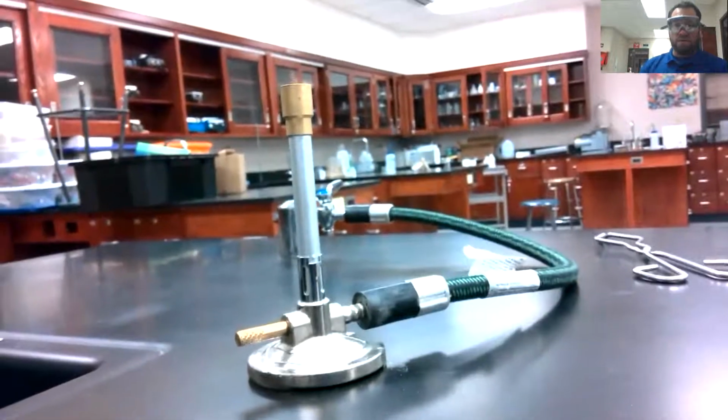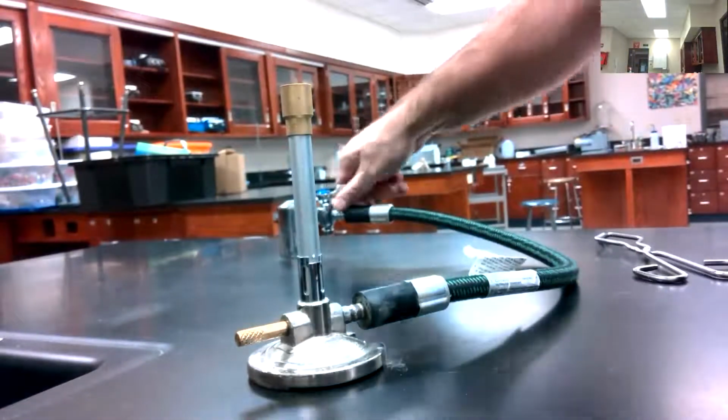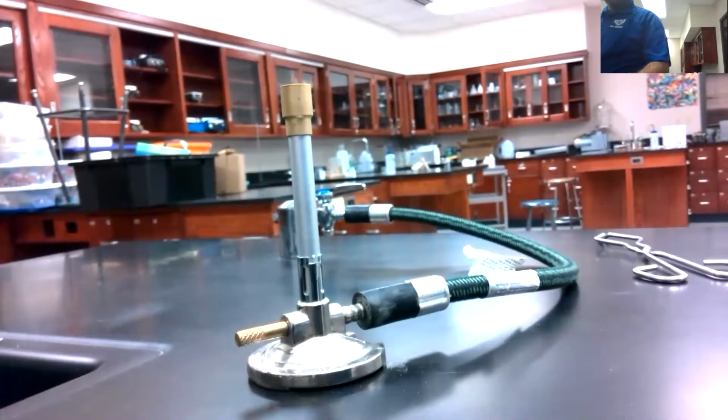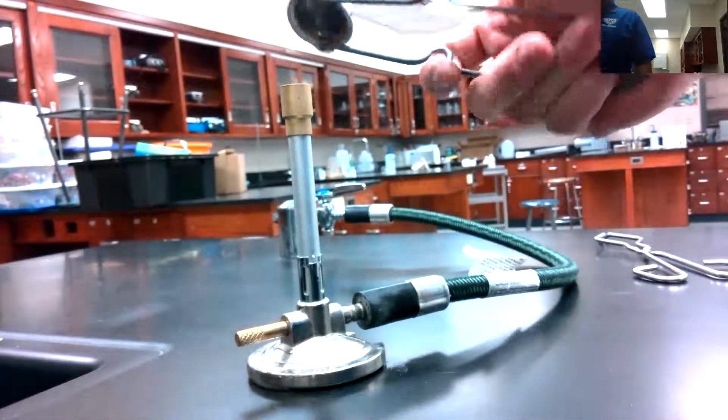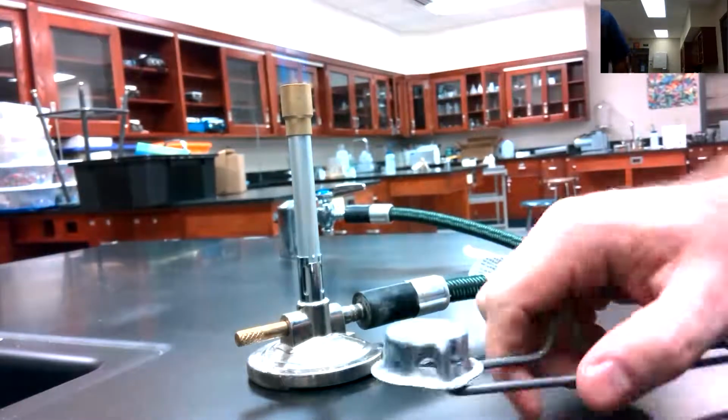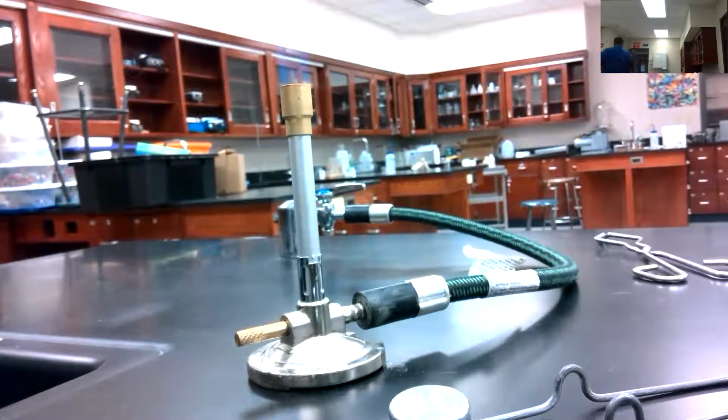Back here using these before you know it. Turn the gas on. There we go. One good strike is all it takes. You need 3 strikes. Hey, there you go. It shows up a lot better, doesn't it? Just that flame there. There you go. There you have it.